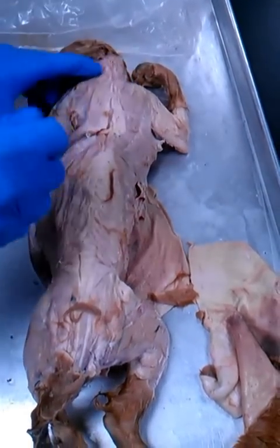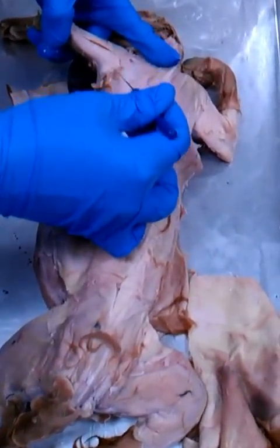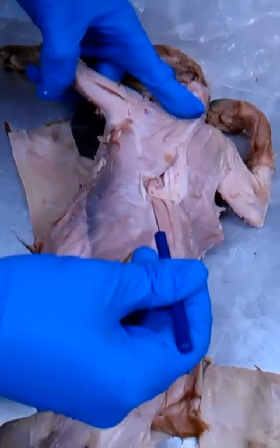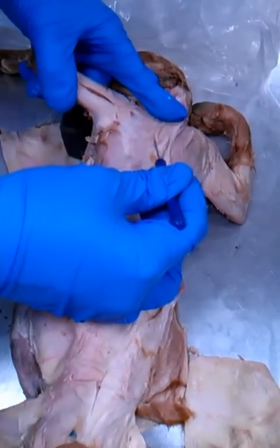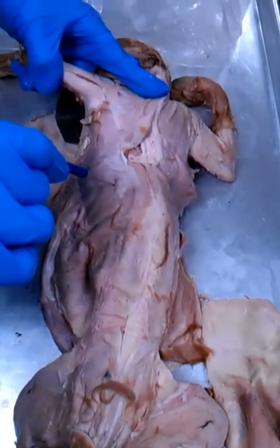Now, we also have this one. You can actually see a line. See this line where it's white to dark, right across here? I can't get this not to stick there. Right there. That line separates this one up here, which we already talked about, which was the spinal trapezius, from this large muscle down here, which is the latissimus dorsi.